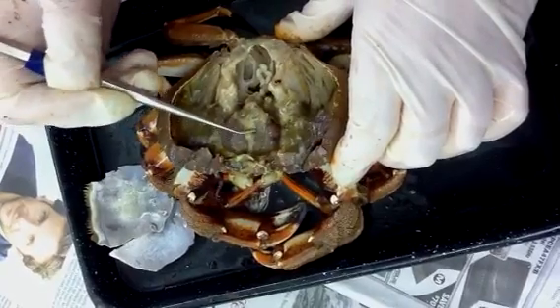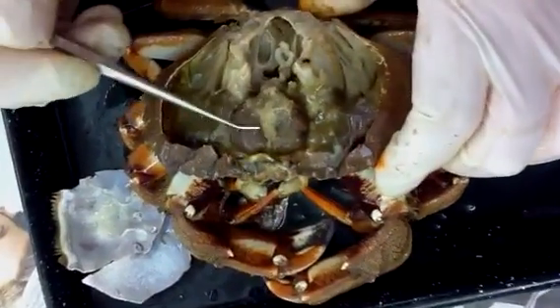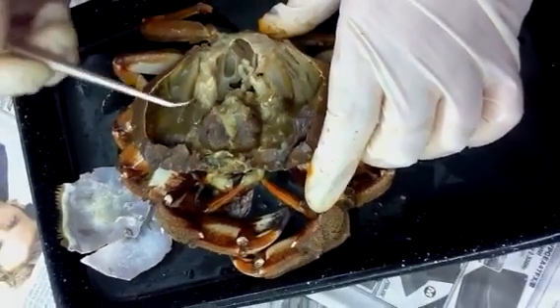You can see these clear structures up here are nerves that are coming from the eye. They kind of got separated now that we've been playing around with it.